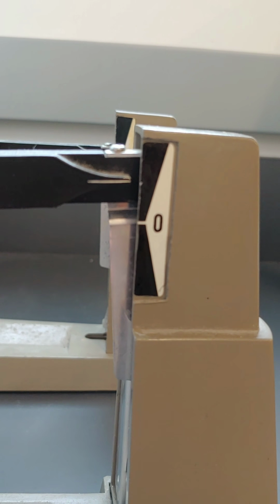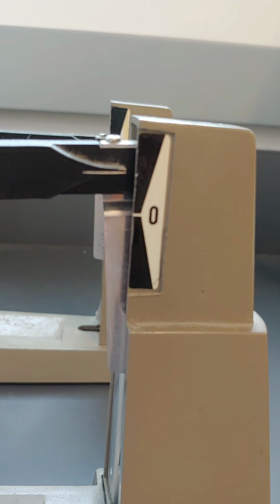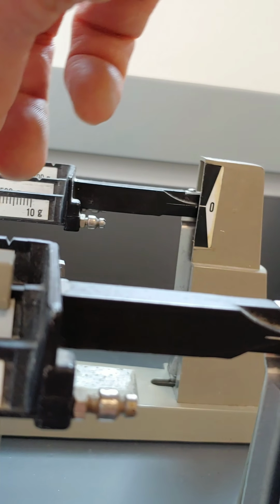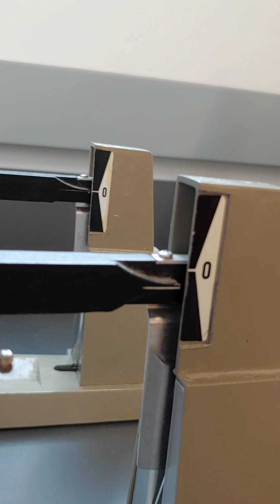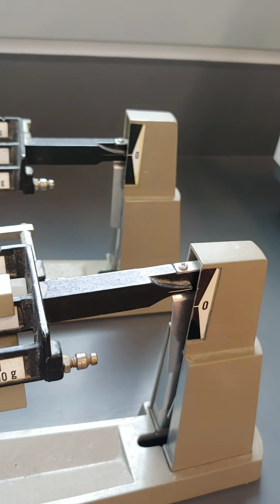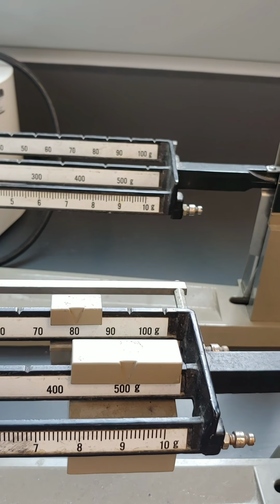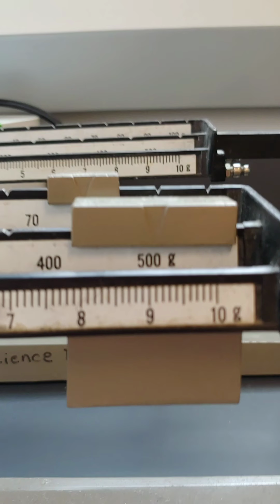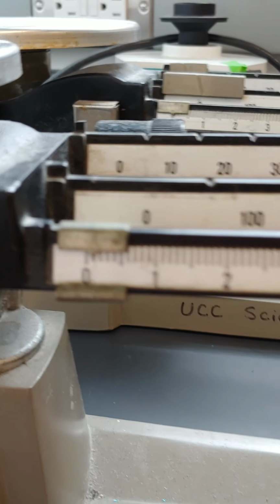So I might have added something that was a tad too heavy. And so let's see, so nope, 500 grams. Oh, okay, so there we go. So now we'll go back until our little line goes below, or actually we want it to go above. Okay, so there's 570, so we know it's more than 570. Then if I move it to 580, it goes too far below. So the mass is somewhere between 570 and 580. So I'll move this back to 570.